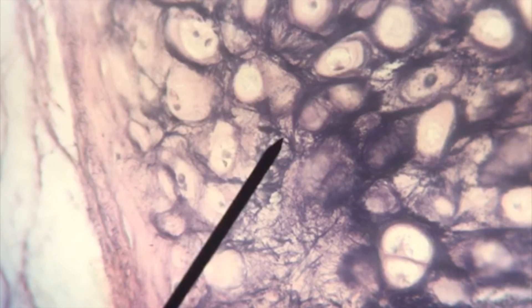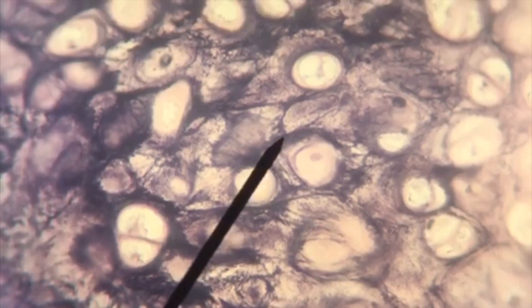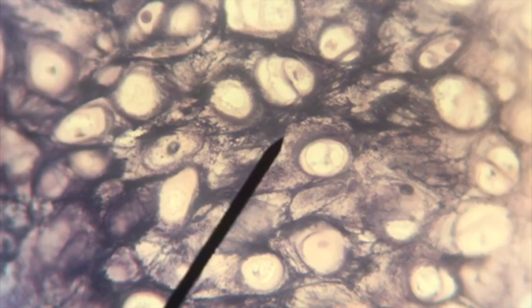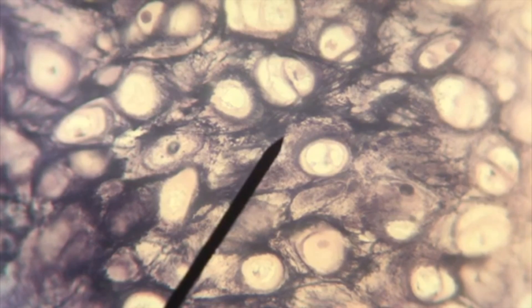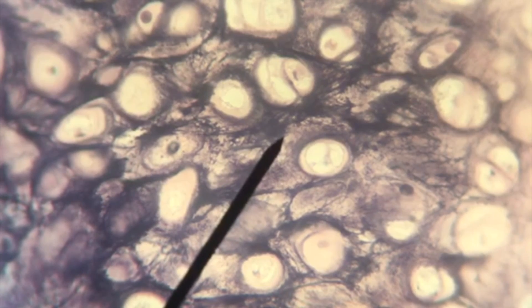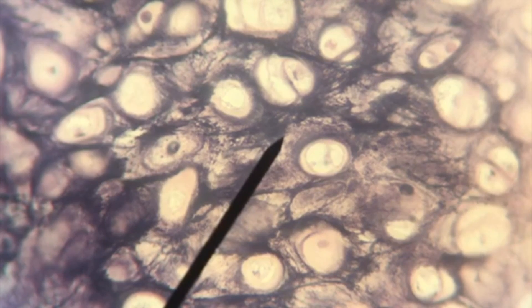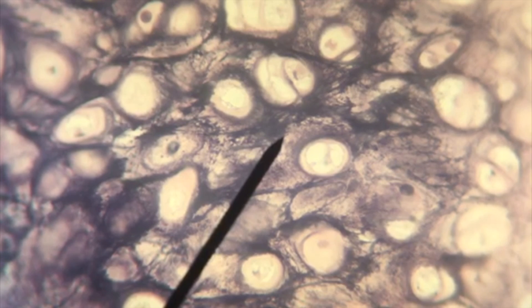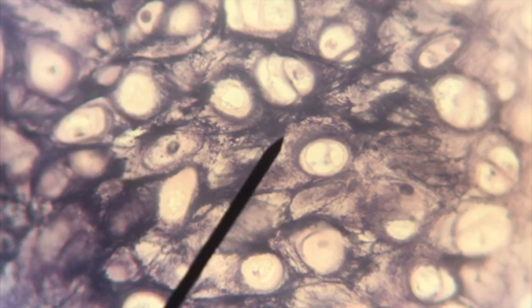The last type of cartilage we're going to look at is elastic cartilage — not to be confused with elastic connective tissue found in arteries, which allows for elasticity and elastic recoil. Elastic cartilage is found in the human ear and in portions of the larynx or voice box. Again, the lacunae and chondrocytes are consistently found throughout all three types of cartilage. The key difference is in the matrix — look at the matrix. How would we describe it? Black and stringy. These black and stringy fibers are large numbers of elastic fibers.